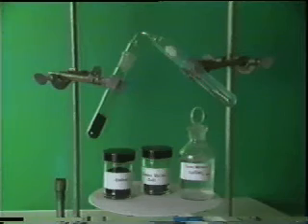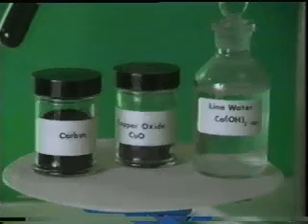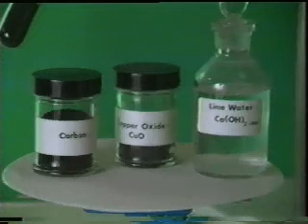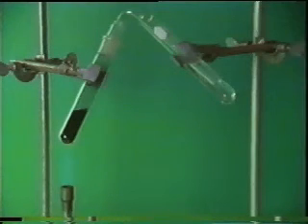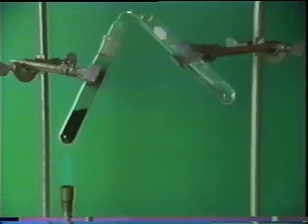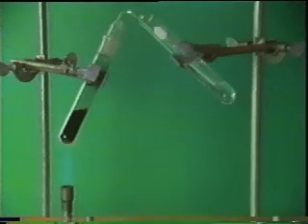In this experiment, we heat together a mixture of black carbon powder and black copper oxide. The gas evolved is passed into a solution of calcium hydroxide, that is, lime water.